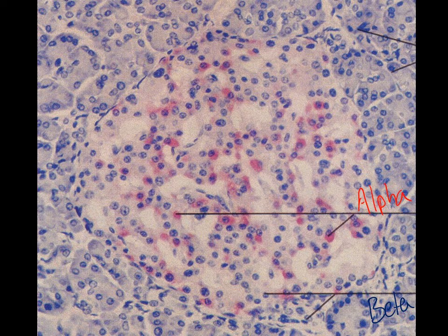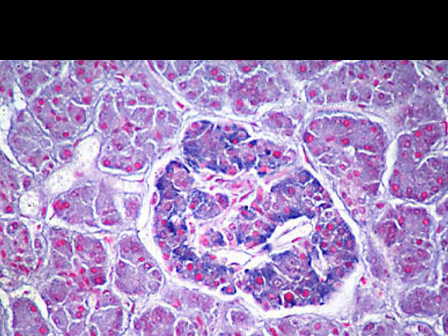And so alpha cells stain red in their cytoplasm, beta cells stain blue in their cytoplasm, but they have generally the same kind of a scheme that goes along there. And again, different hormones being produced from each one in terms of our insulin and our glucagon. Different picture. This one here allows us to think about the thought process that not all slides look exactly alike, but the general pattern is there.